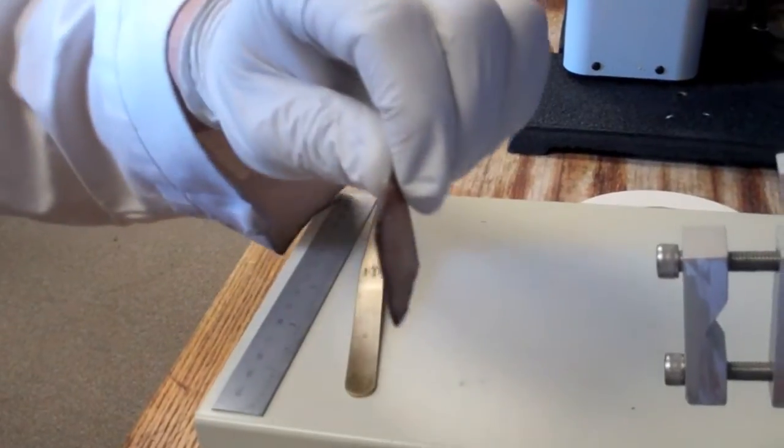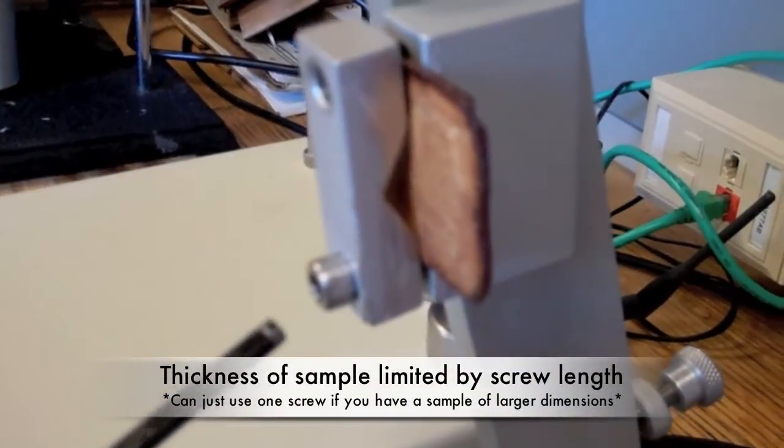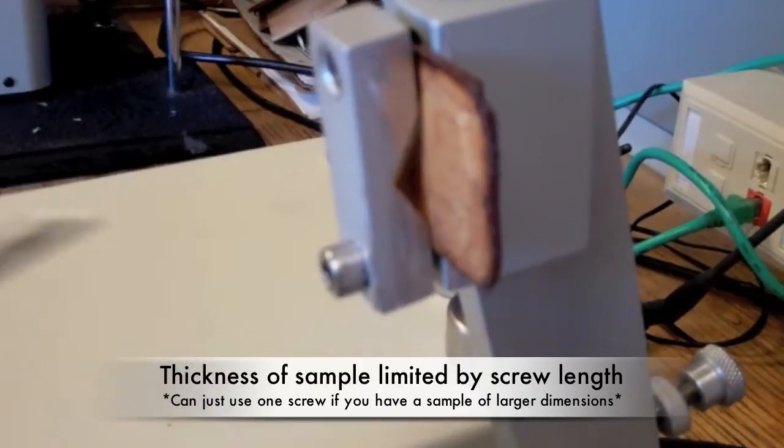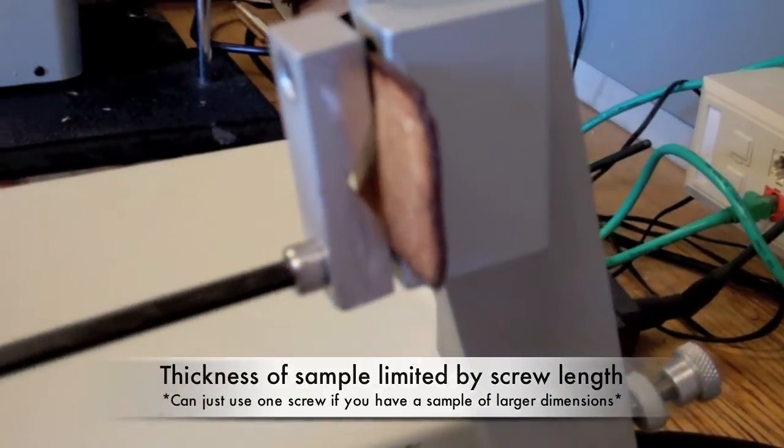Longer bolts can be obtained for larger samples. This sample cannot fit between the two screws. Therefore sufficient pressure with one screw will be adequate in holding the sample.